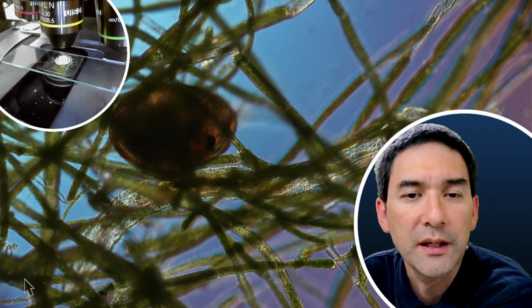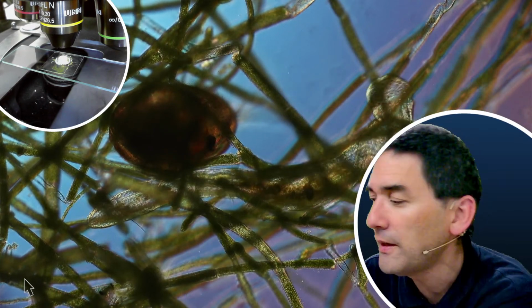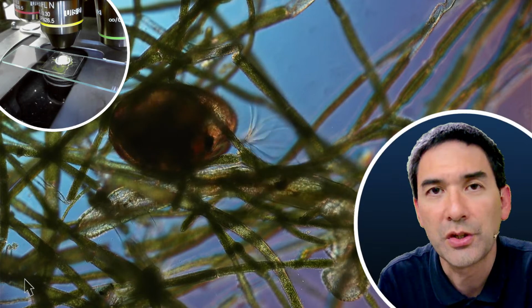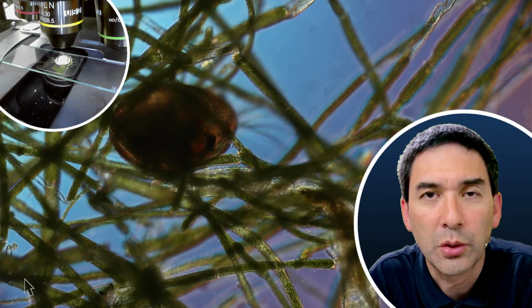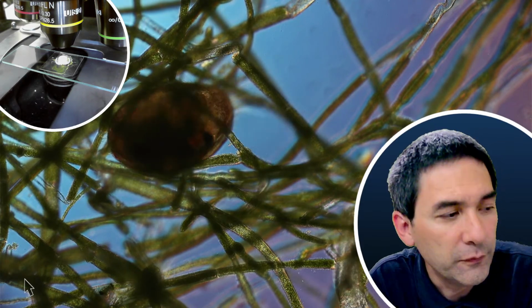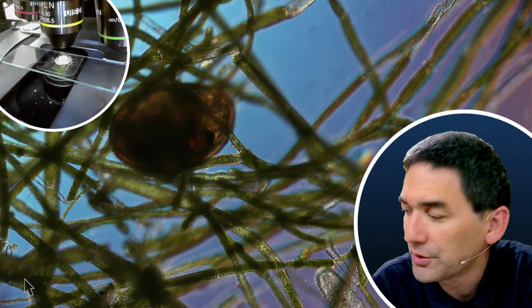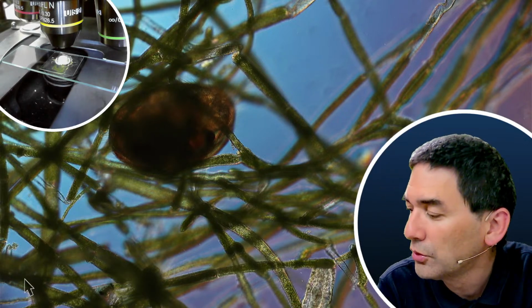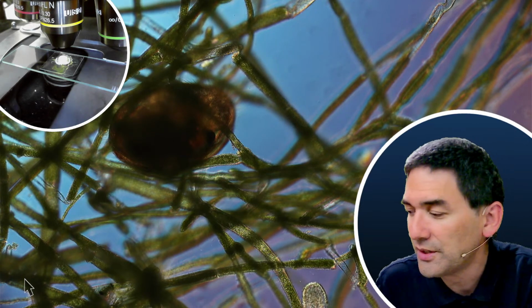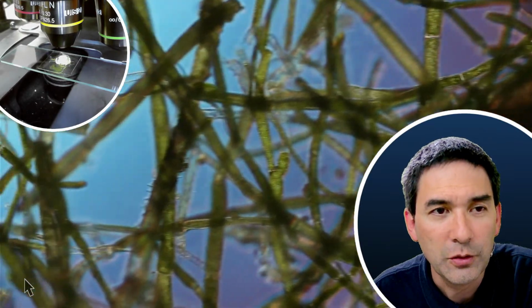Some of you already requested that I talk a little bit more about microscopic techniques, and I can do that, maybe about phase contrast, DIC, and so on. I'm currently planning an episode on so-called oblique illumination, where I use oblique illumination filters. I need to unpack and set up a different microscope for this, because my current one does not allow me to put in the filters that I want. So if you've got a microscope that has a filter holder, this is something you might want to try out.